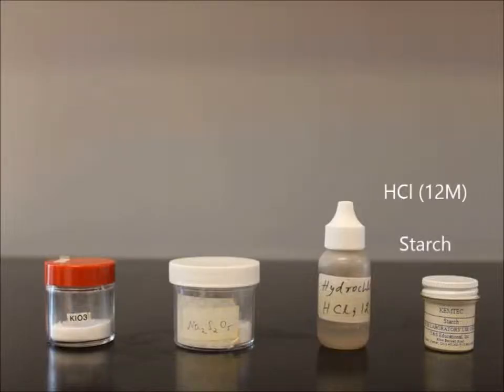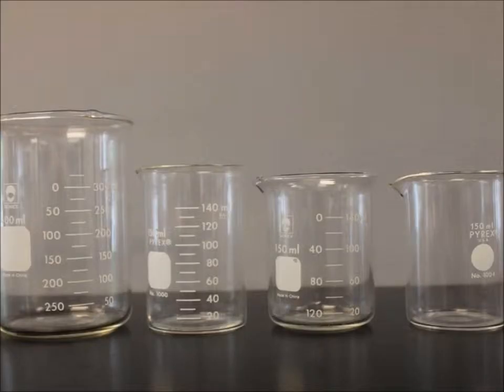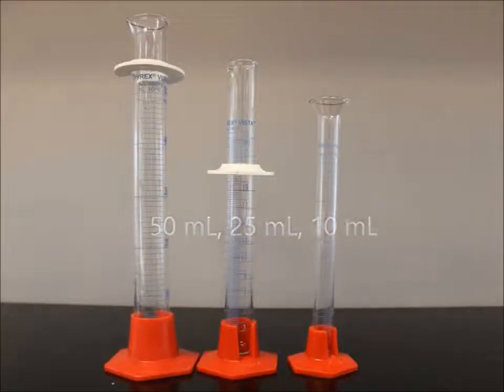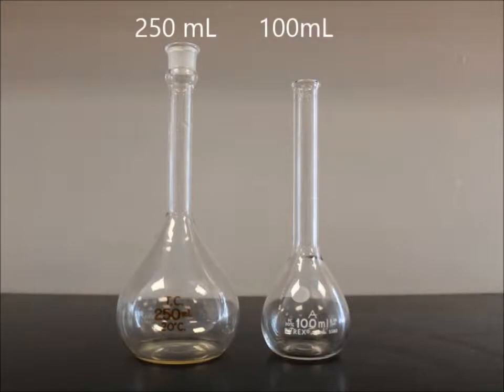concentrated HCl, soluble starch, 4 beakers, 3 graduated cylinders, and 2 volumetric flasks.